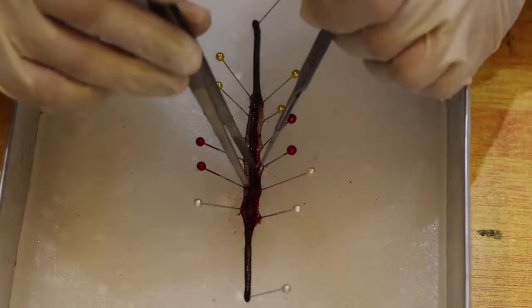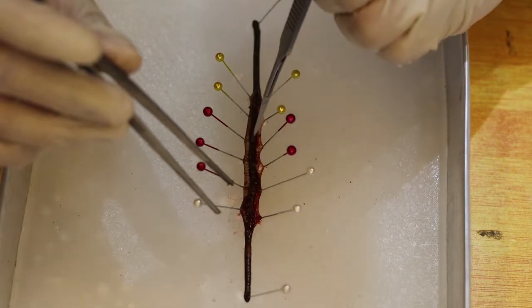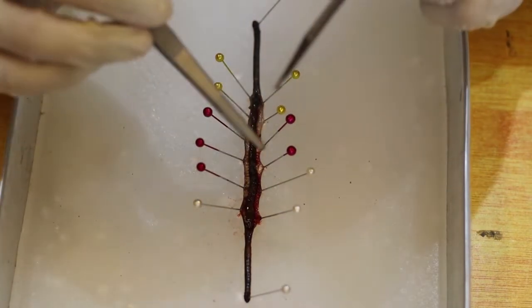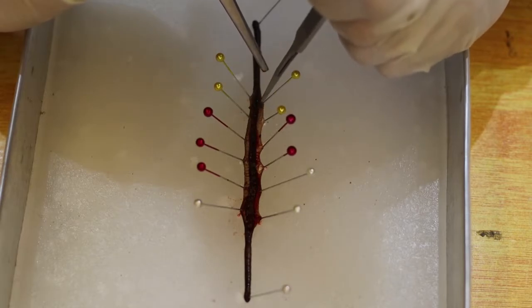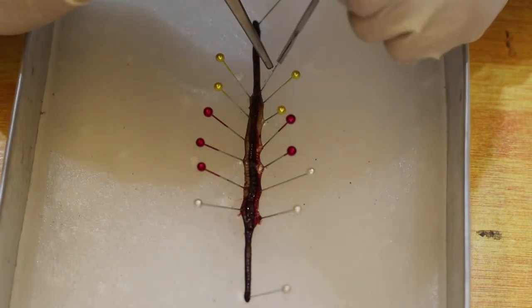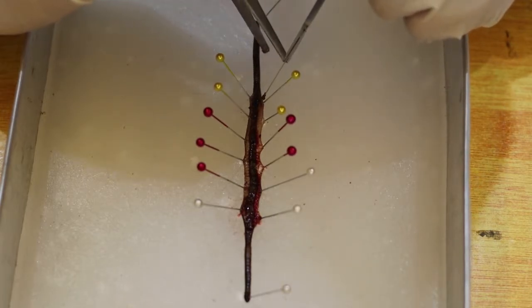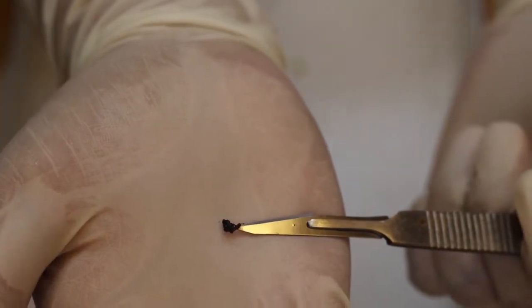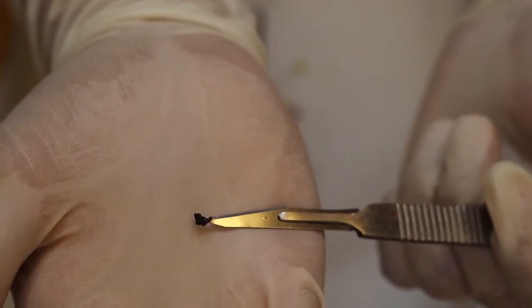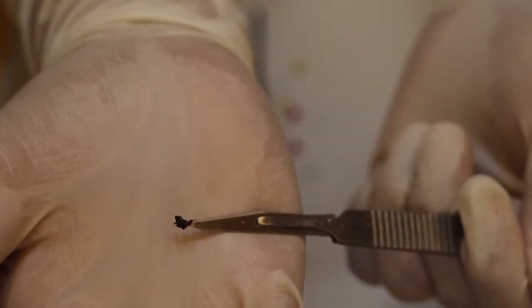So let's observe the thickness of the intestine. So all of this is what you call the intestine. Let's open. As we open the inside of the intestine, we can see some black materials that move out. So that's now the topsoil. Can you see that one? That is the black material. This is what you call the topsoil.